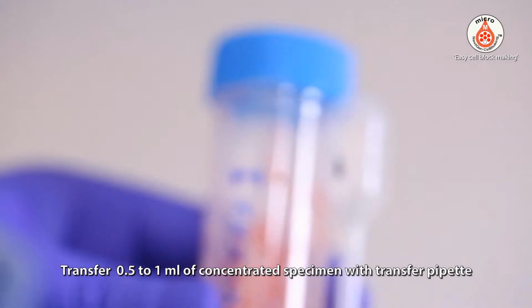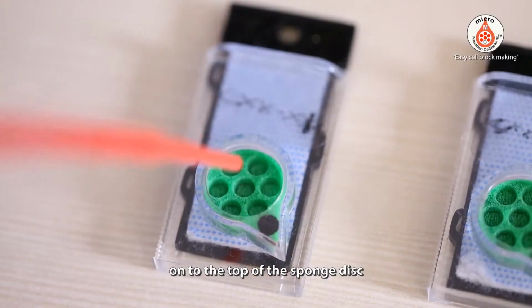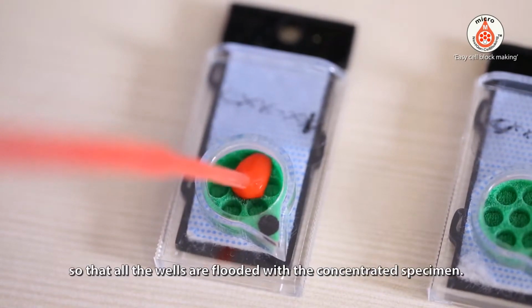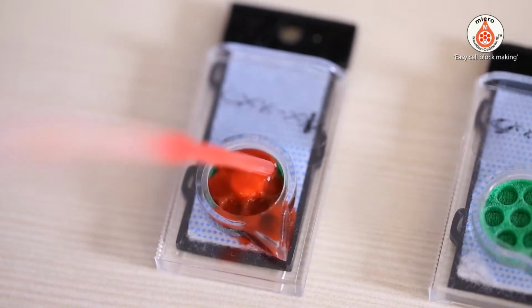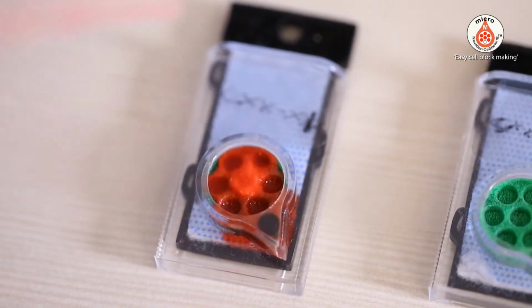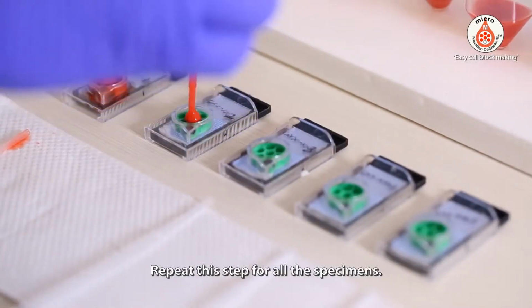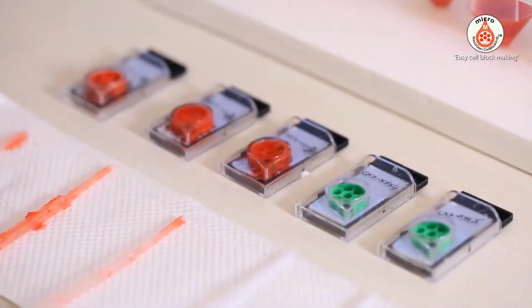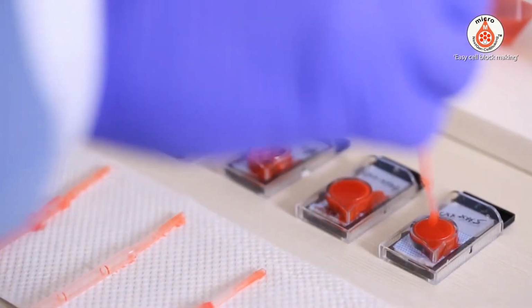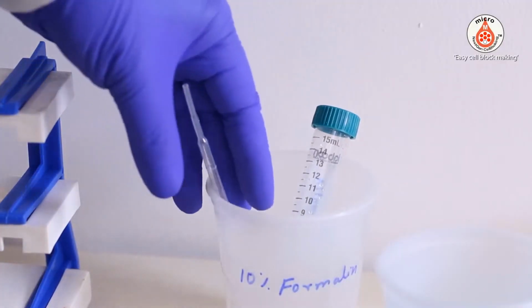Transfer 0.5 to 1 ml of concentrated specimen with a transfer pipette onto the top of the sponge disc, so that all the wells are flooded with the concentrated specimen. Place the used transfer pipette in its place. Repeat the step for all the specimens. Wait for 10 minutes for the liquid component of the specimen to be absorbed.